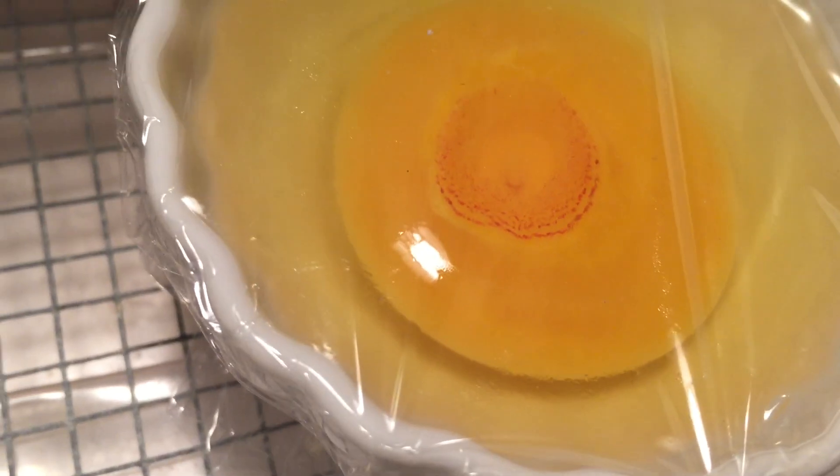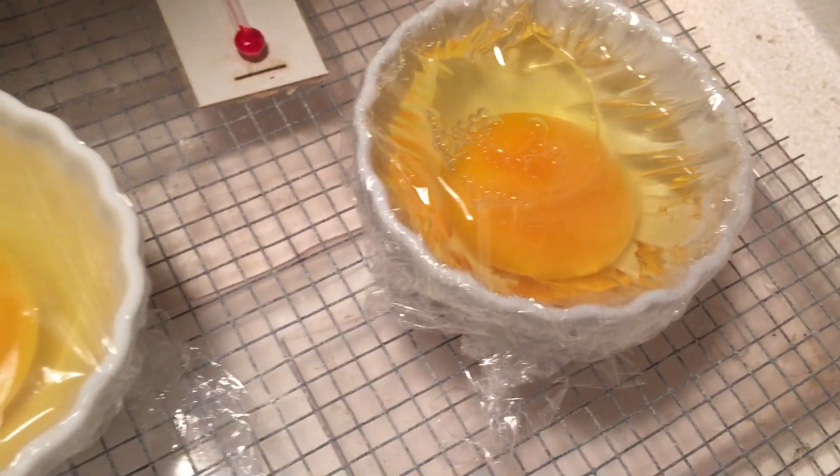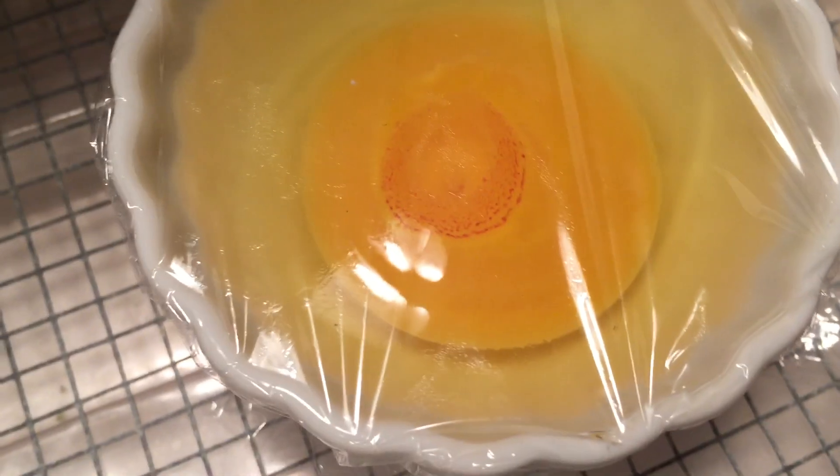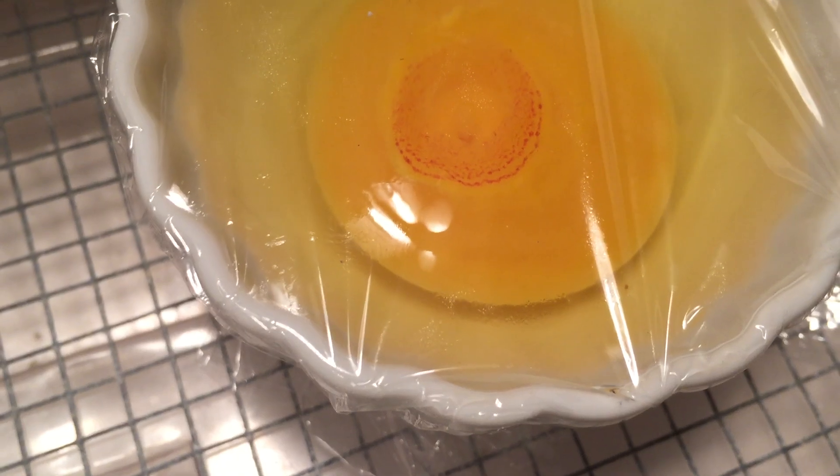It's definitely a work in progress, but I do have other projects coming up — just a couple more days, actually two more days, until the next one starts. I do have the rapid filter that lets oxygen in and CO2 out, but I never really had much success with that.